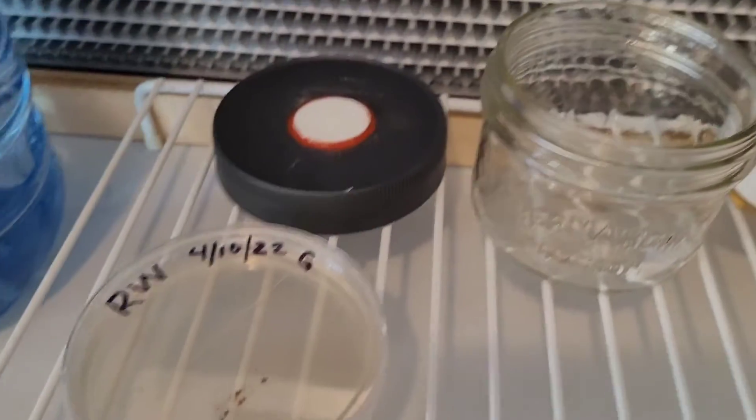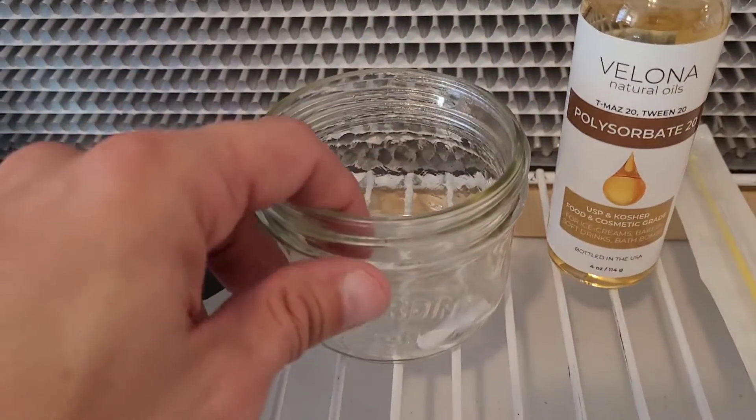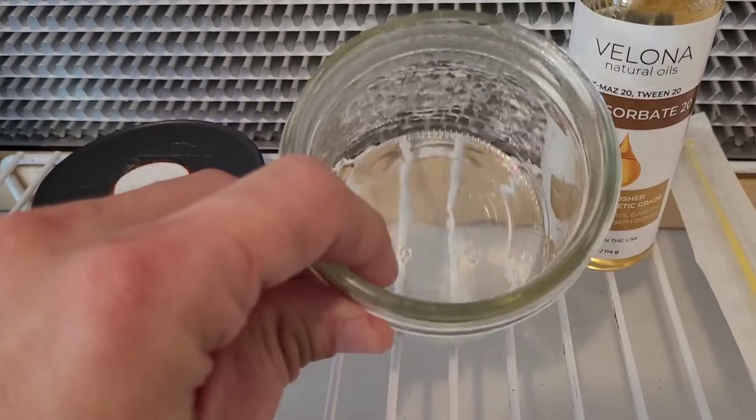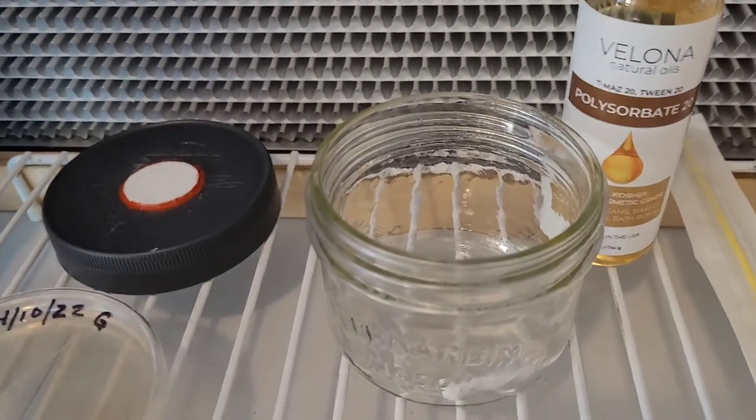So I'm going to rehydrate it by adding some distilled water to this jar. I have a magnetic stir bar in here so that once the spores are deposited into the sterile water it will remain suspended.